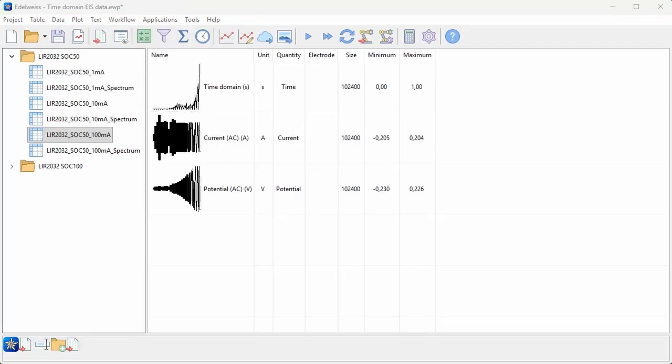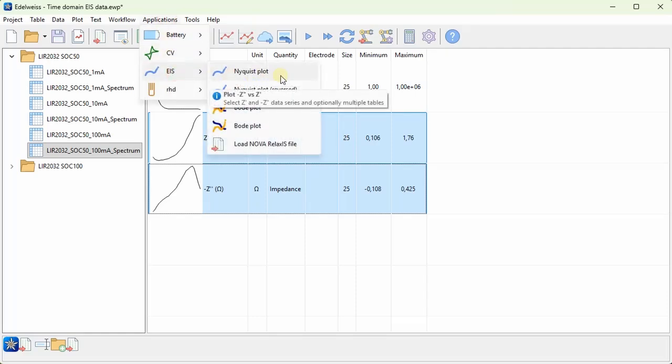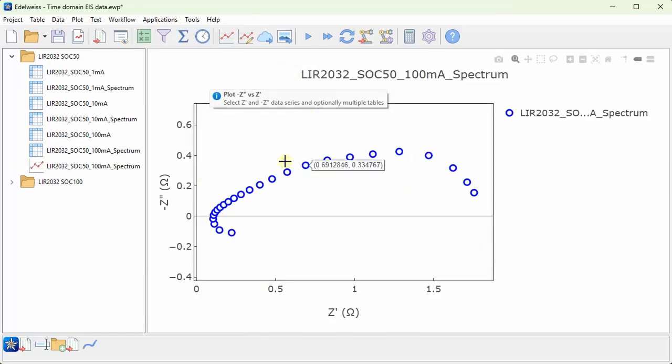So what do I mean by time domain EIS data? Well, I have several spectra here of a lithium-ion battery, and I can plot a Nyquist plot of one of them. And each of these data points, of course, corresponds to the impedance of one frequency. And these impedances are calculated from the AC current and voltage applied to the cell.